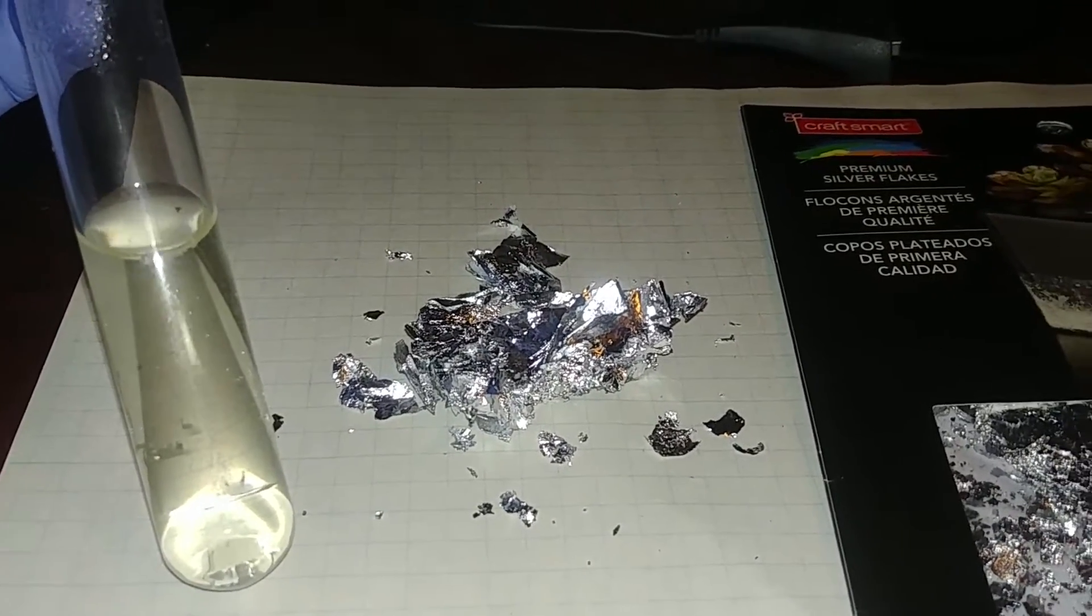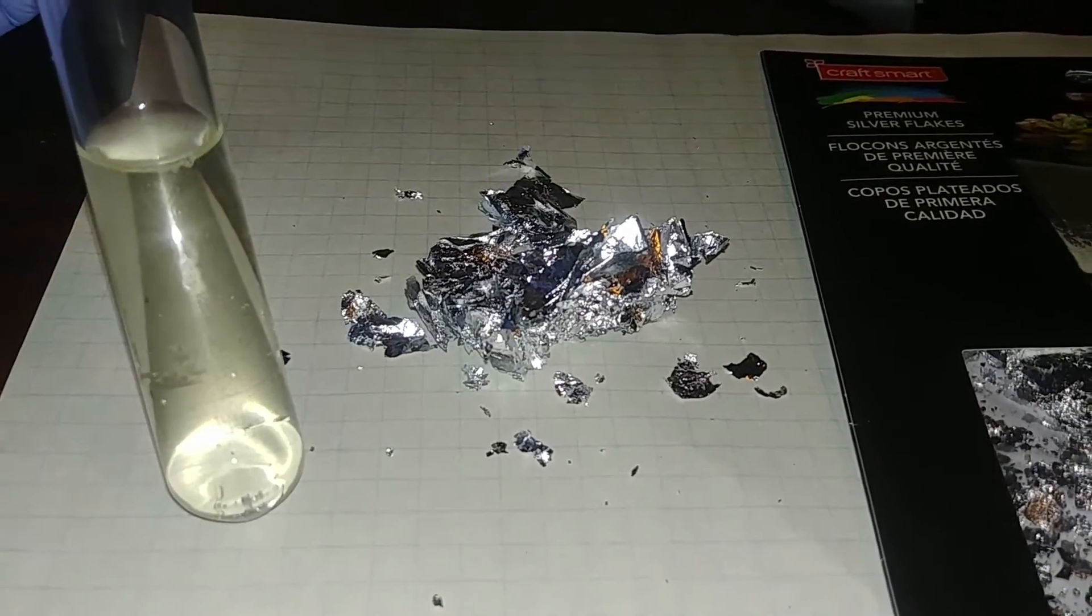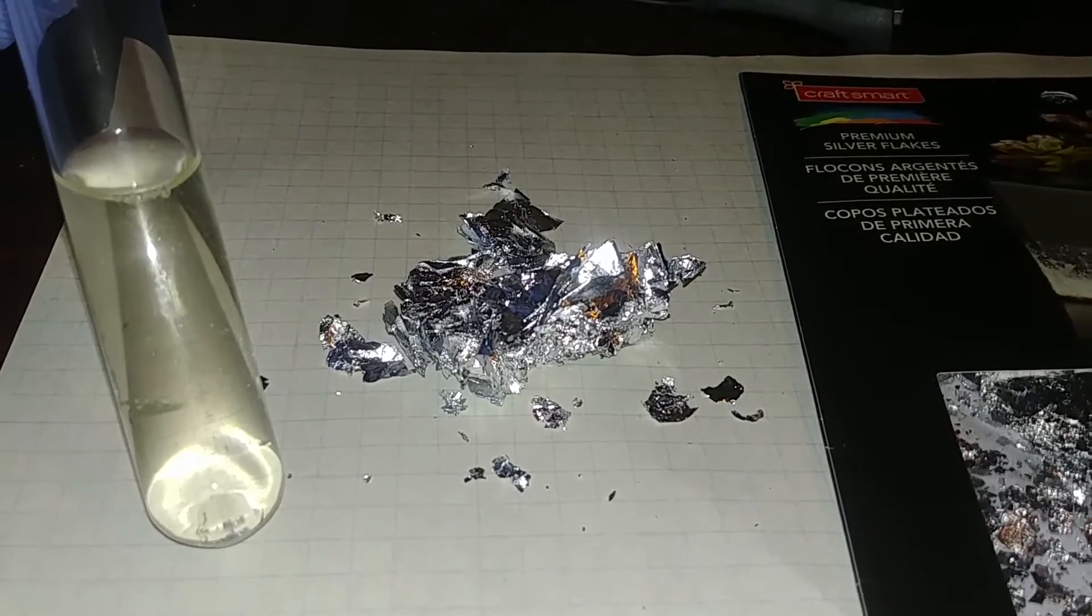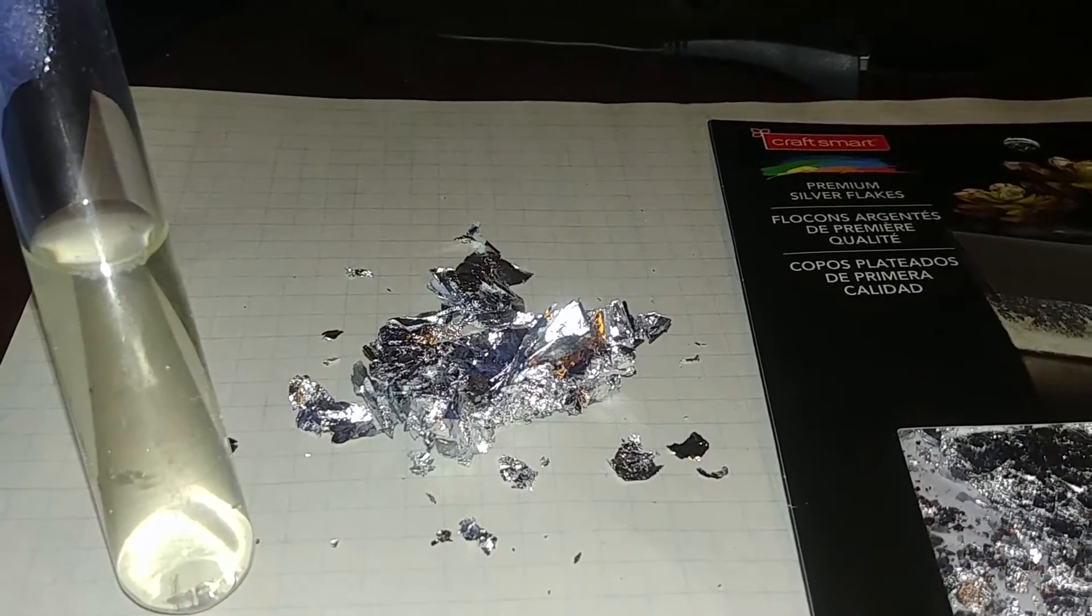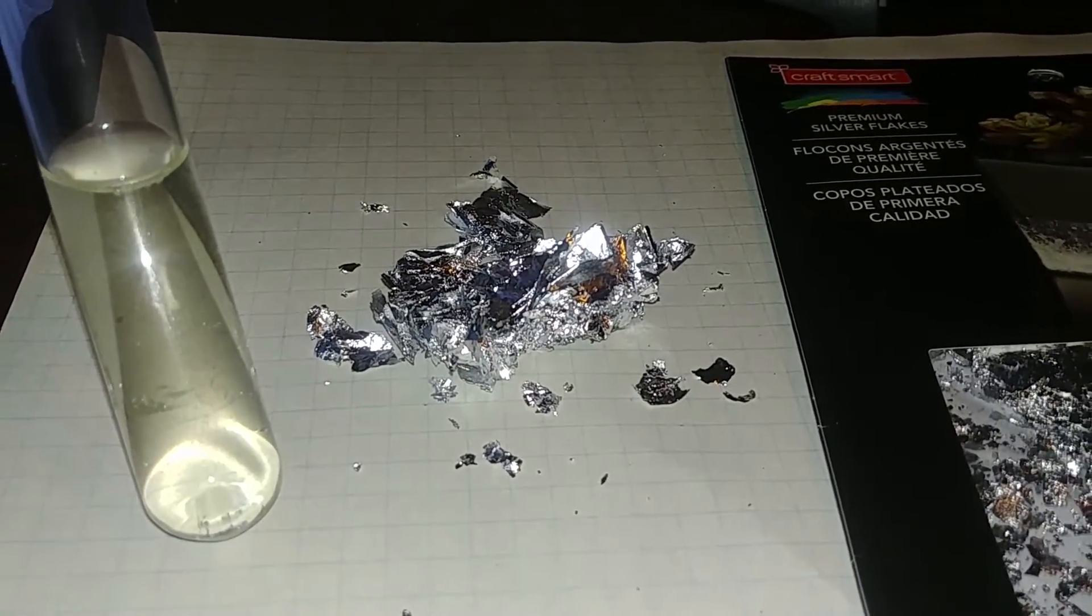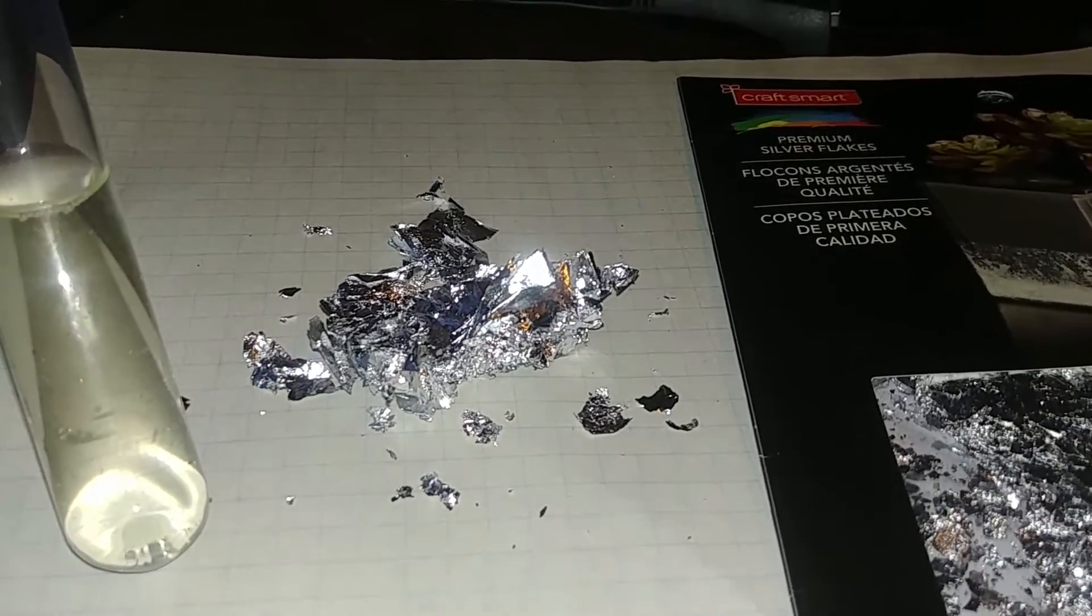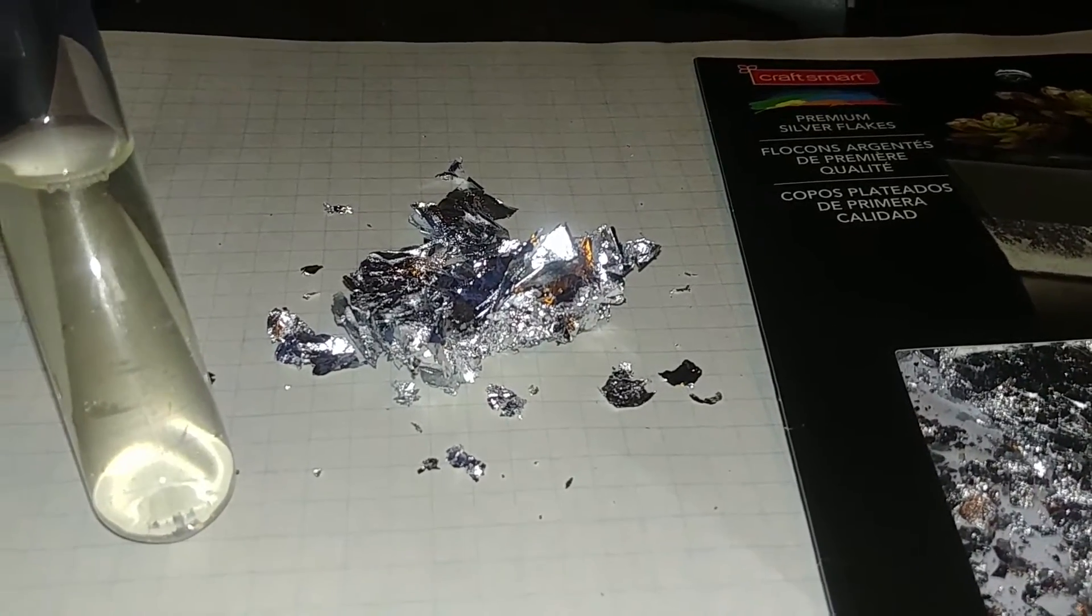But anyhow, I haven't seen anybody else using the silver leaf. And I thought, if there's people out there that don't want to have to buy a troy ounce or destroy an extremely valuable silver coin that's worth more than the silver it contains, then this is definitely the route to go. This stuff is cheap. Like I said, it's 99.9% pure sterling silver.